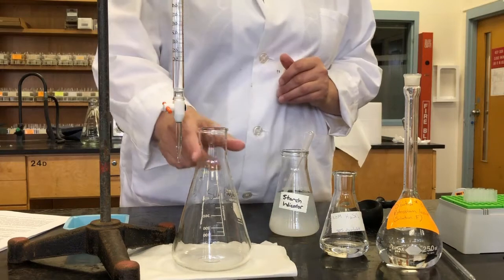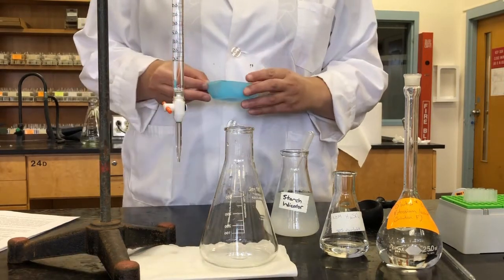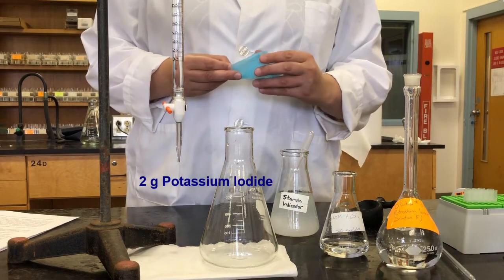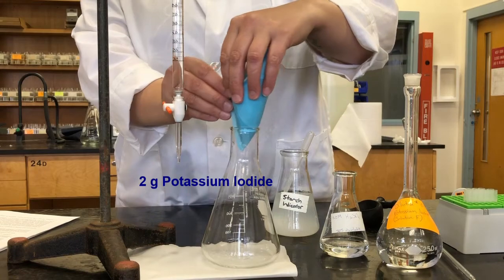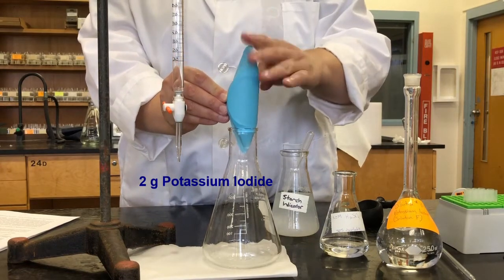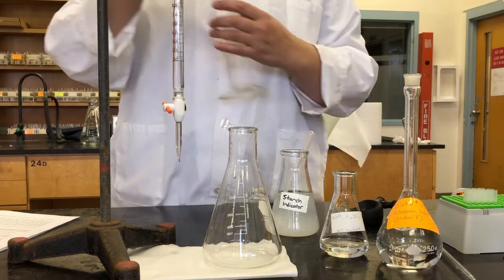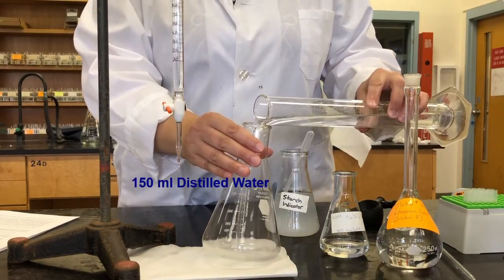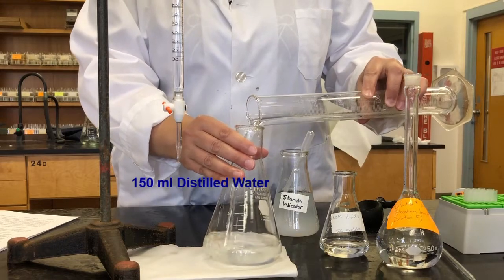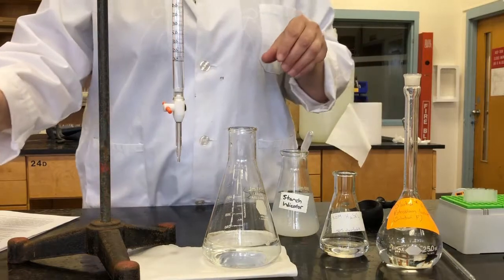So you may remember from last week, our sodium thiosulfate is in the burette. So we're going to add our reagents to our flask here. So we have 2 grams of potassium iodide again. Let's add that to our flask. Then we're going to dilute it in 150 milliliters of distilled water using a graduated cylinder.